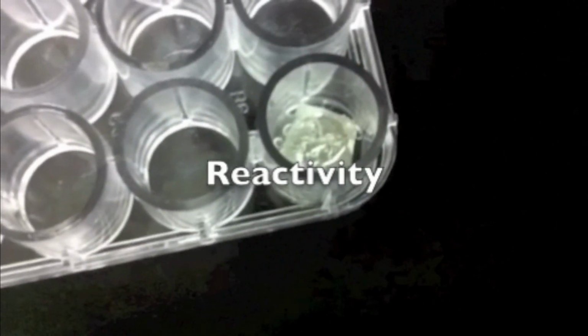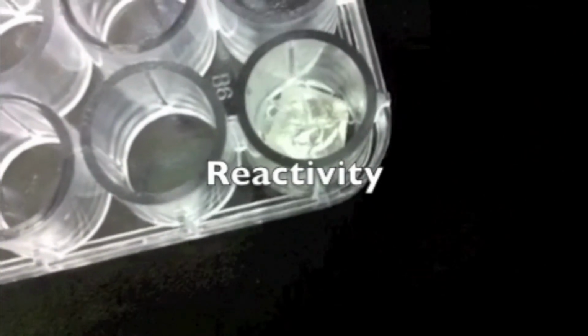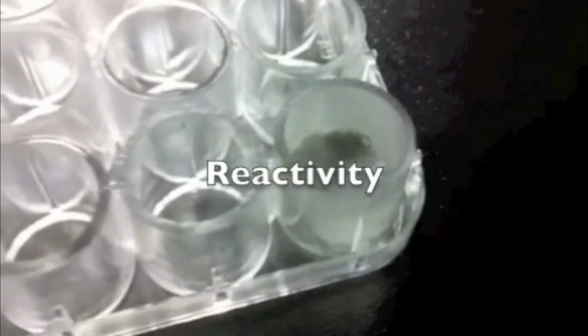As the name suggests, reactivity is when a substance reacts or combines with a different substance to make a new substance. In this case, it's aluminum foil. Yes, aluminum foil has a lot of chemical and a lot of physical properties. And this is when aluminum foil actually reacts or combines with hydrochloric acid. As you can see, bubbles are forming. And bubbles are a sign of chemical properties because it's making a new substance.